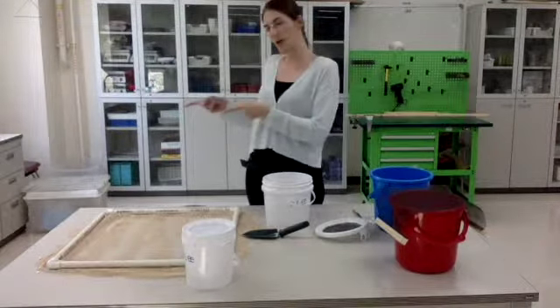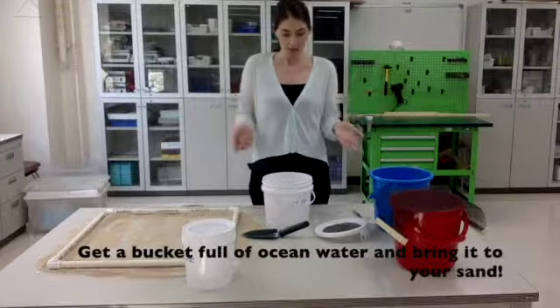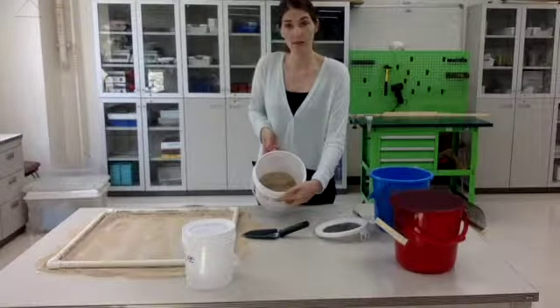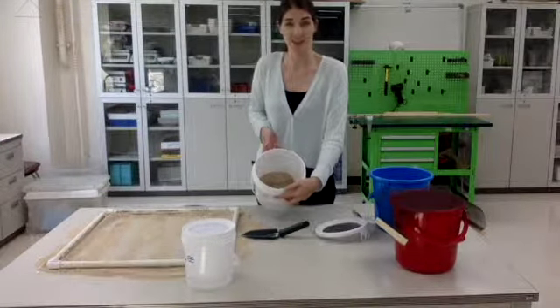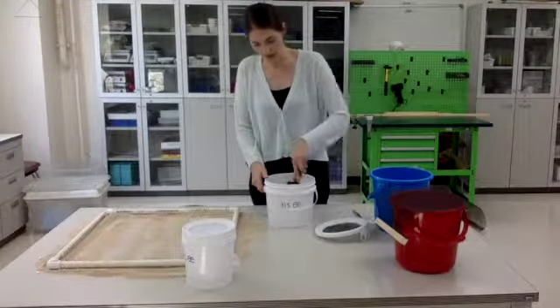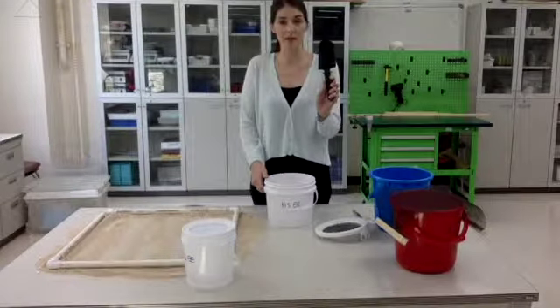I got my water from the sink over there, but you can just use ocean water. So what you want to do is fill it up until the sand is covered with a couple inches, and then stir it a bit. You can just use your spade to do that, your trowel.